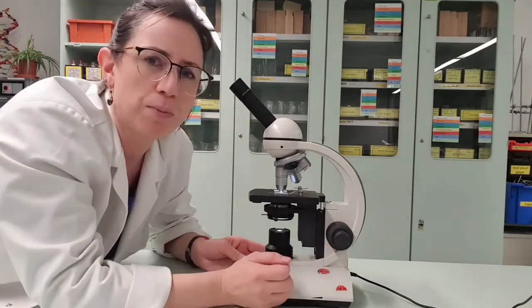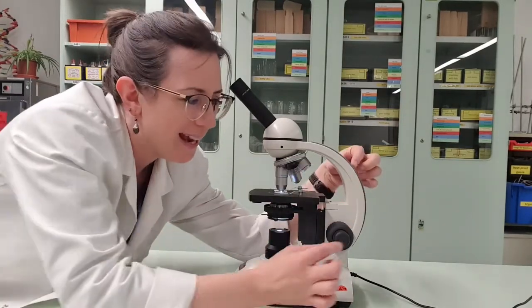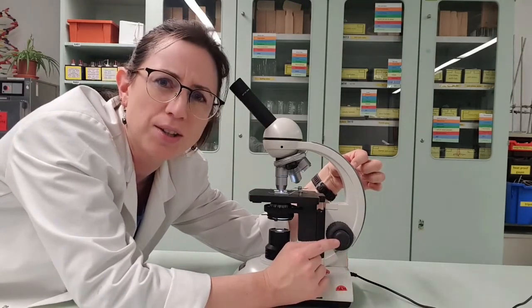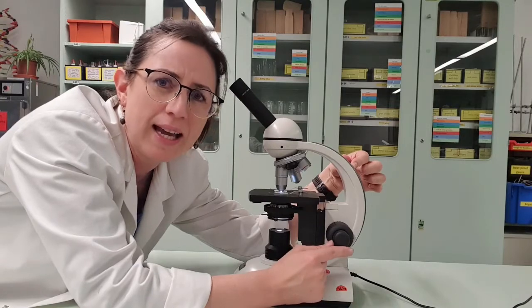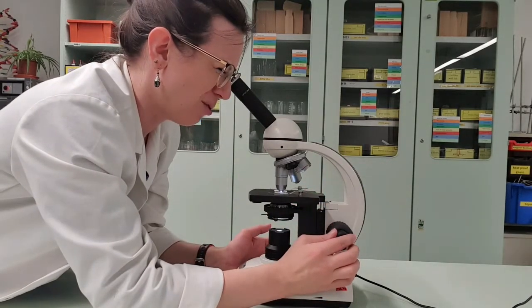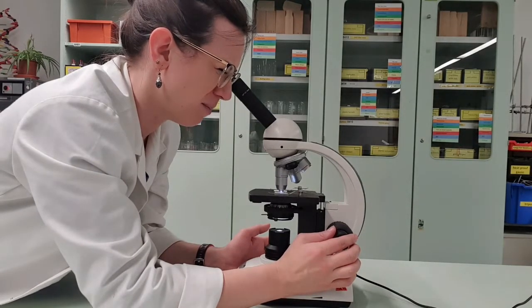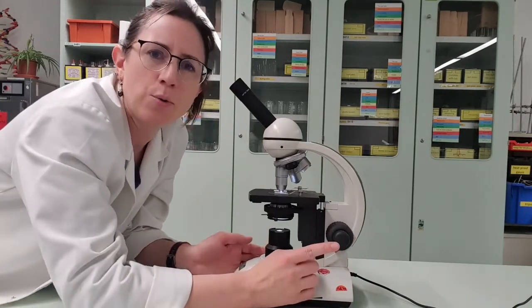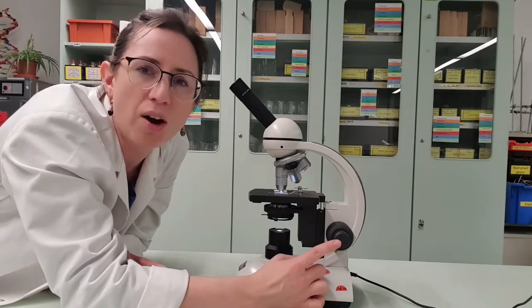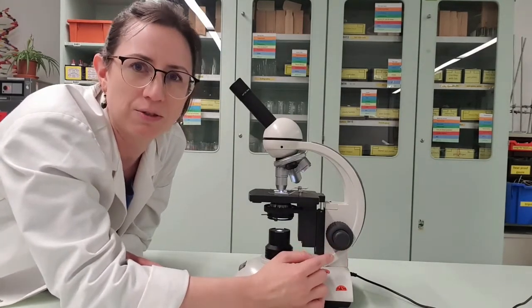On this microscope, the fine focus is not up here where you typically would see them. It's actually on top of the rough focus. So that might be a little harder to see there, but it's this smaller dial here. So I'm just going to tweak that until I get a really crisp image. And there you have it, some muscle cells. Now the fine focus should only really be used on the highest magnification. That shouldn't be touched on any of the lower magnifications.